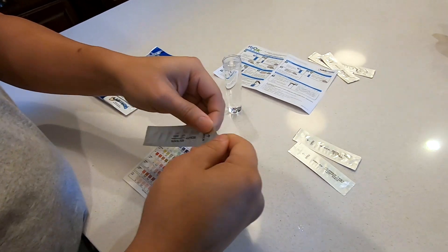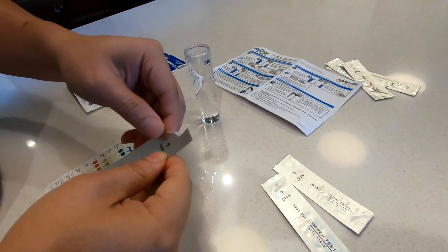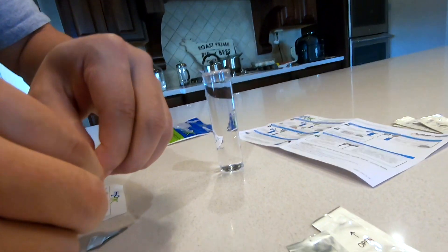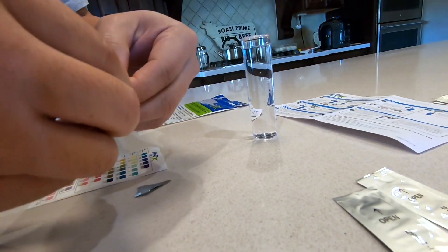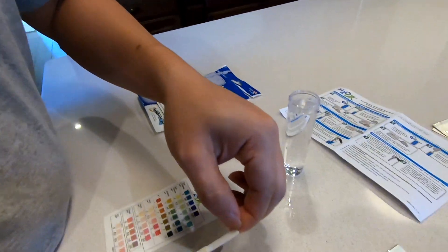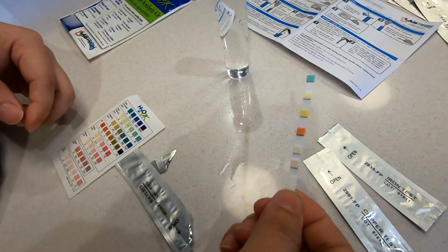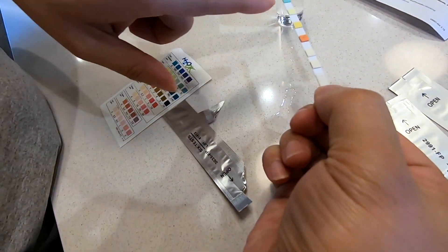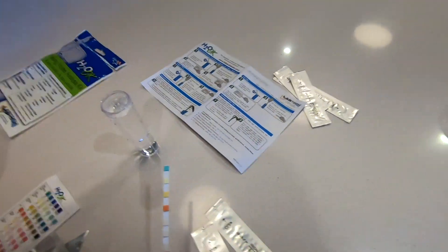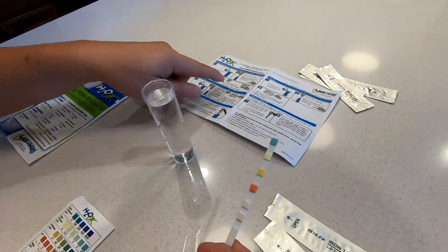I'm doing the six test first. I opened the six test strip package, and here is the strip. Make sure you don't touch or hold any of those small testing pads. Your hand should only be at the last pad here where your hand is touching.